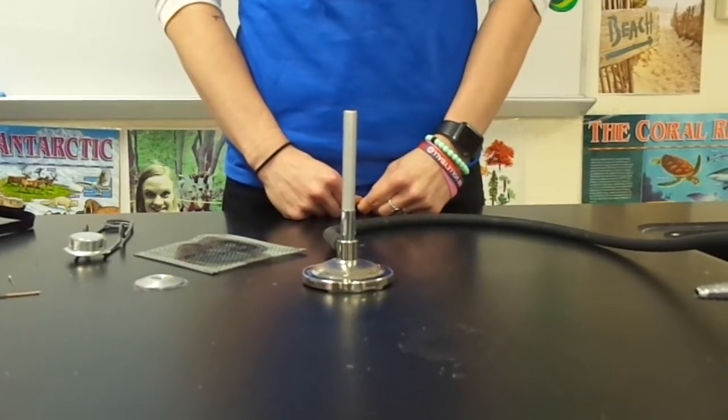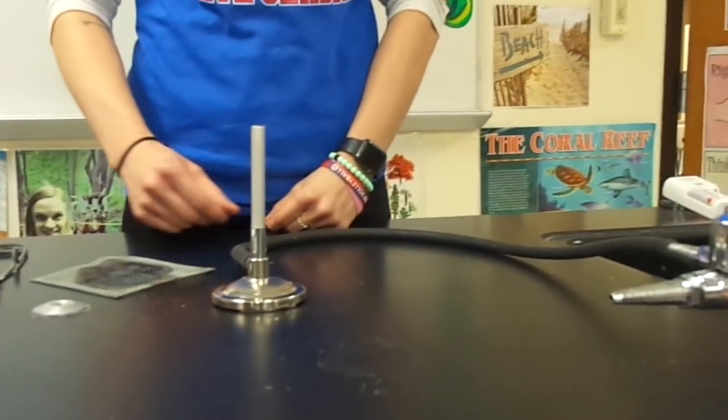Now that the gas is shut off we're going to twist the collar of the burner so that the air control valve is now open.